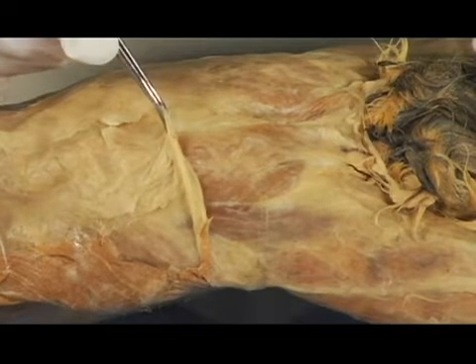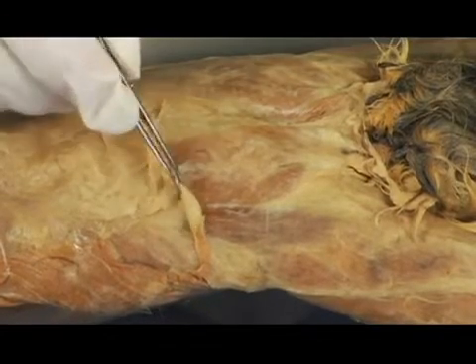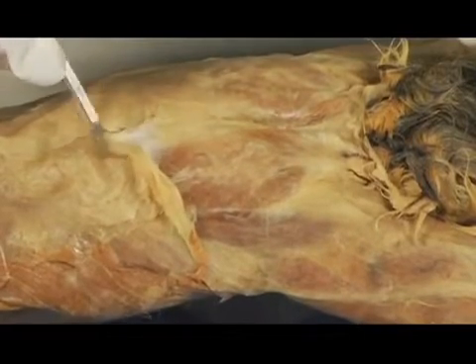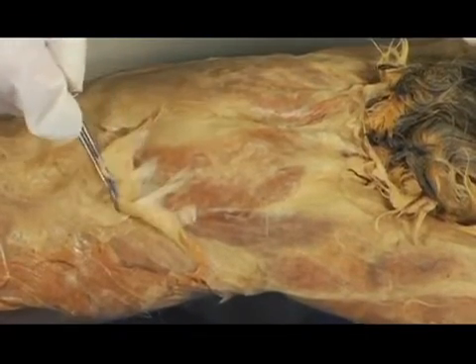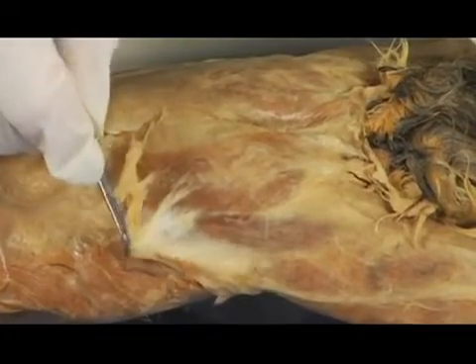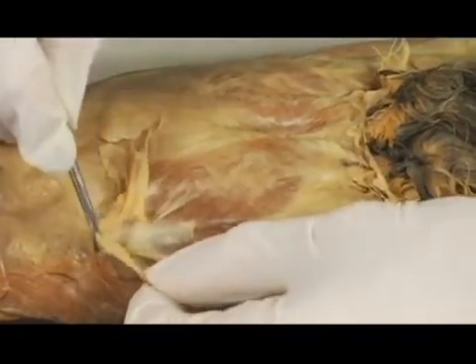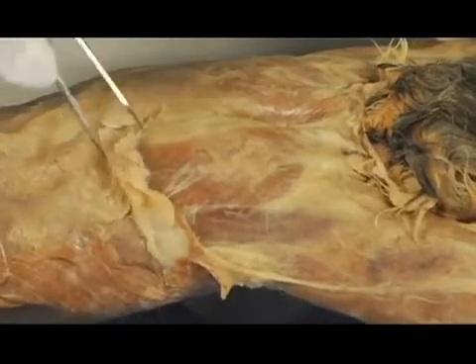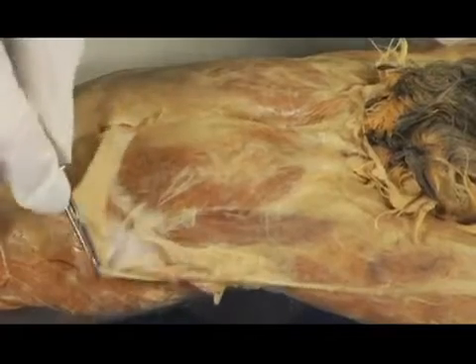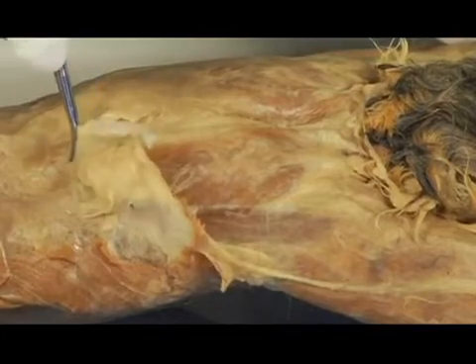So I'm going to go ahead and try to tug away at some of this fascia. And it's coming off pretty well. In fact, you'll be lucky if your cat's fascia tissue comes off this well. This is actually very, very good. So I'm just kind of pulling away at it. Again, the cottony material's coming up. You can use your thumbs to help a little bit there. Pull down a little bit on that. Just keep tugging at it. Get more and more of the tissue coming away. Again, it's kind of clear. You see through it. That's the tissue that we're trying to remove.